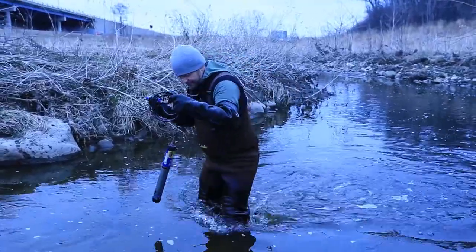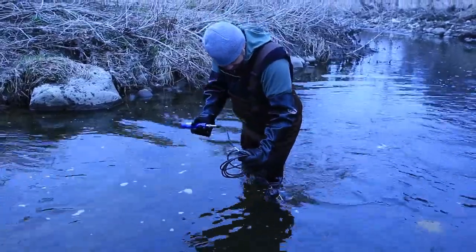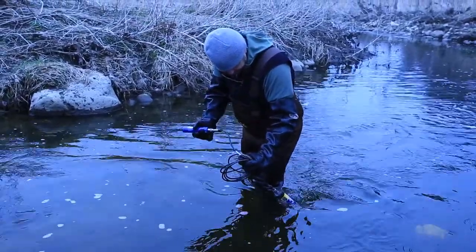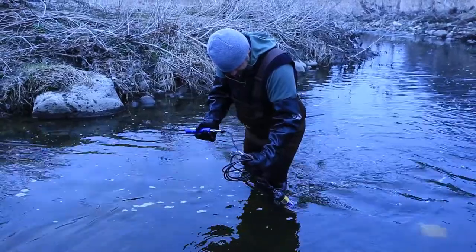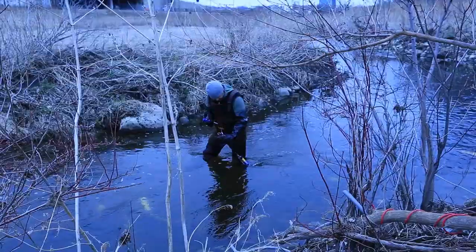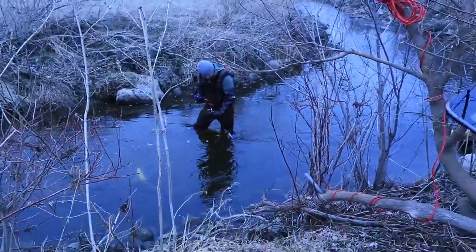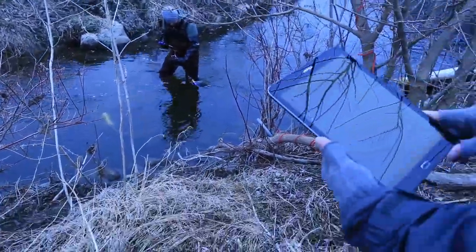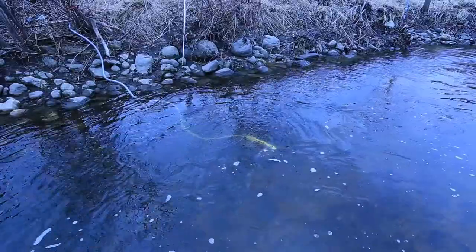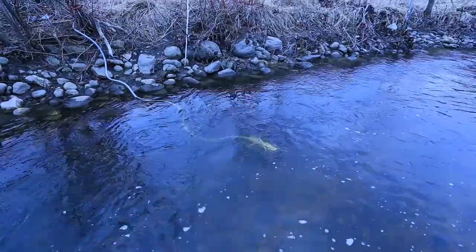First, we use our handheld sonde. A sonde is a device with sensors for measuring the physical conditions of the water. Our sonde measures the water temperature and specific conductance. The sonde gives us real-time data by communicating with our field tablet. Later, we compare these measurements with the sensor we have in the water to make sure the measurements are accurate.